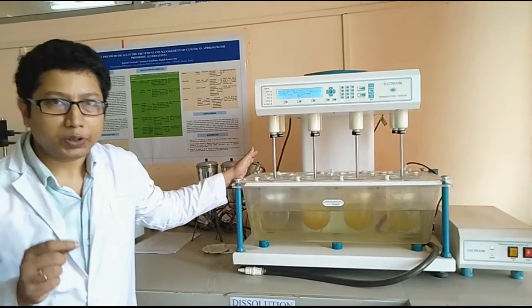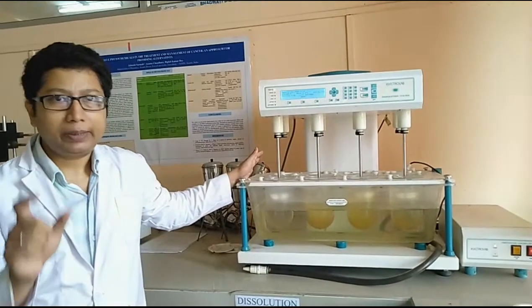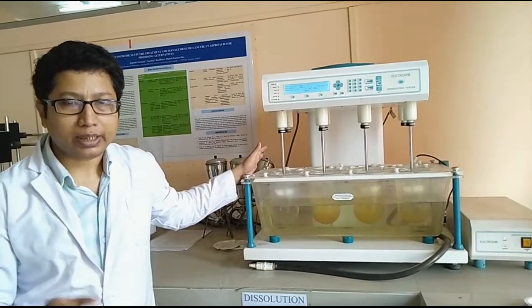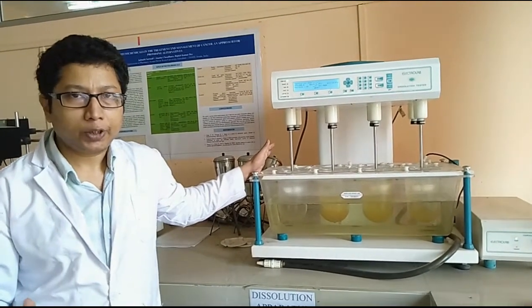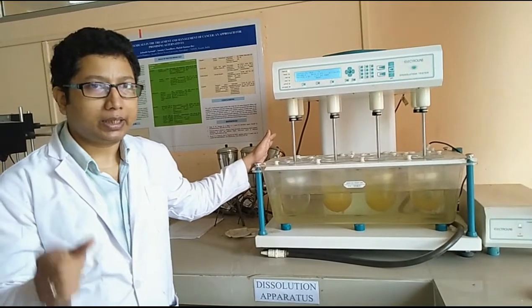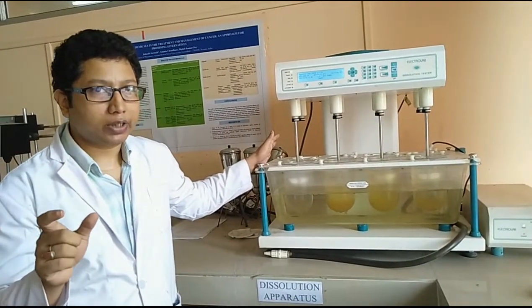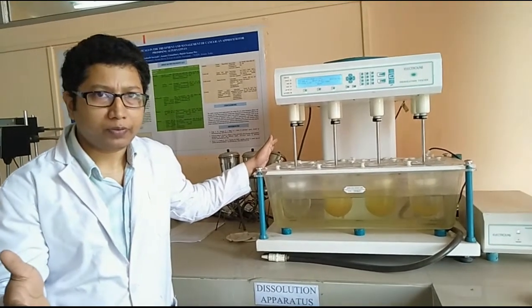First of all, the duration of the study will depend upon the type of formulation you have selected. For example, for a conventional release tablet, you will find in the monograph that the time duration is shorter, it may be 1 hour or 1 hour 50 minutes.